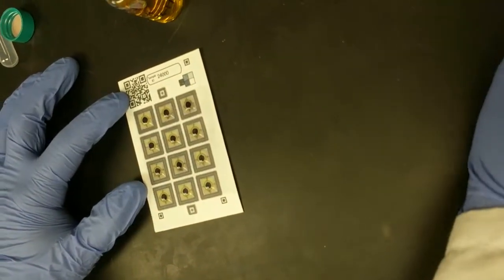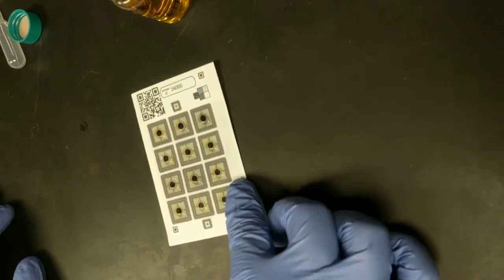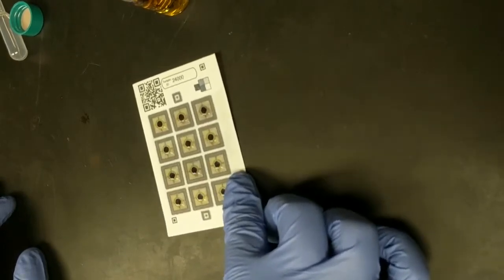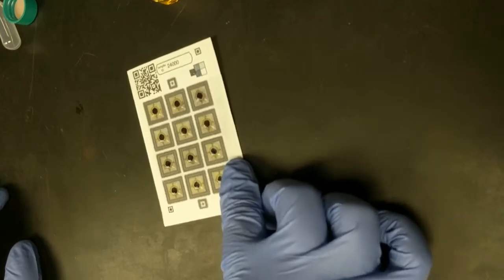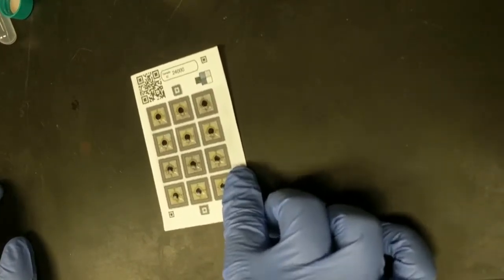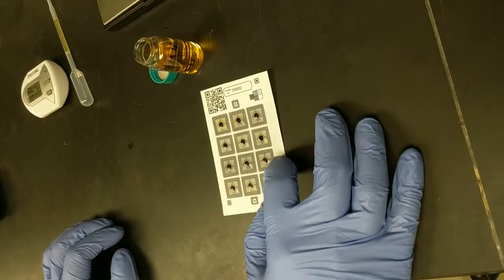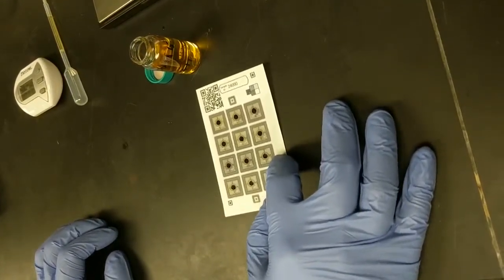Now we have to gently shake the test card for 3 minutes. You can just let it lie on the table and move it back and forth about 1 centimeter. This technique takes a little practice to master, because if you do it too vigorously, the test solution will escape the squares, and then you will have to repeat the analysis. When you open up this test solution, you'll notice a smell. This is from the degraded antibiotic, and it's perfectly normal. It kind of smells like sulfur.